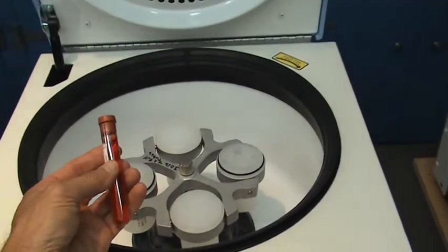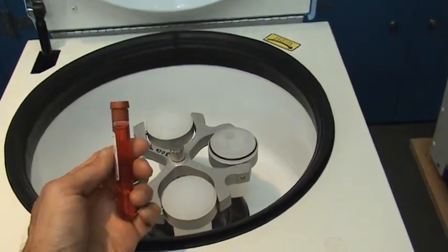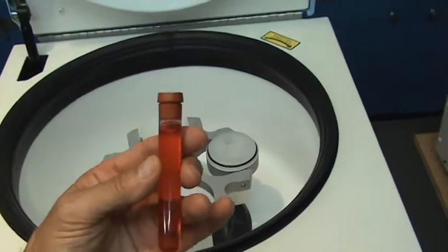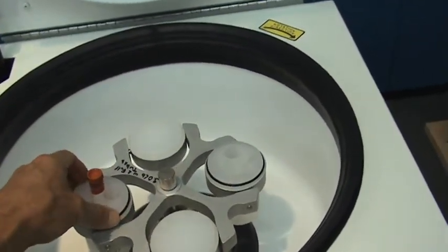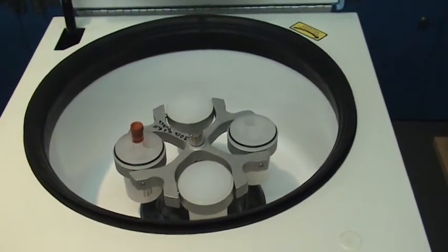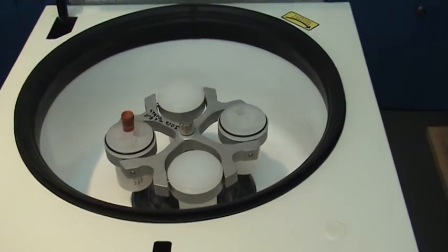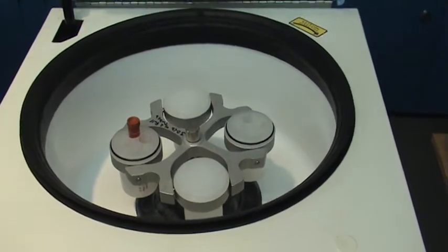If we load this centrifuge rotor with this specimen tube, this is a 10 milliliter plastic tube. It has colored water. As you can see, it's quite full. If we load this into one of the positions on the rotor, this tube weighs about 20 grams. You'll quickly see that this centrifuge is not capable of tolerating this imbalance.